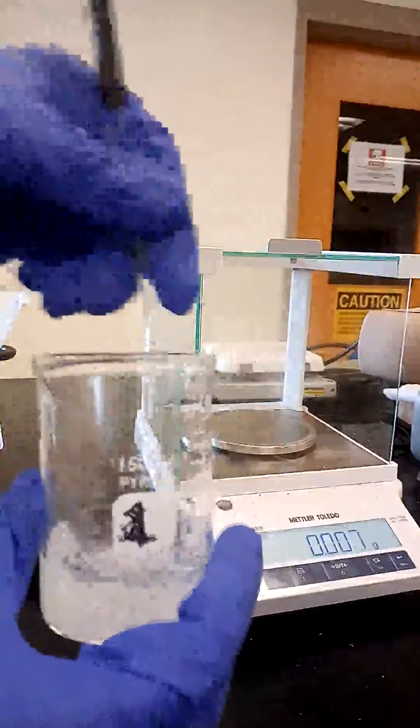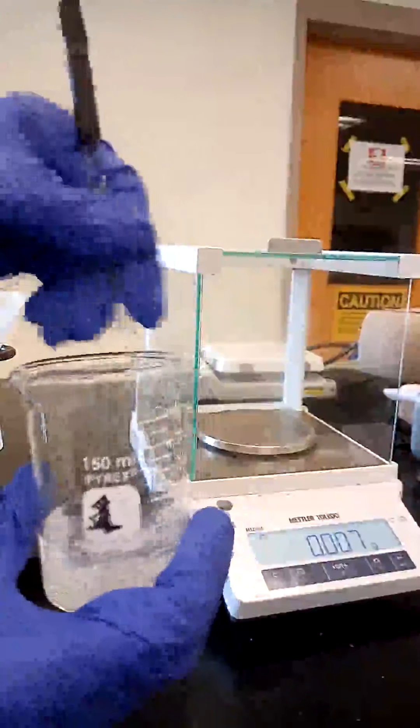And we stir this for 2 minutes after we add the water.